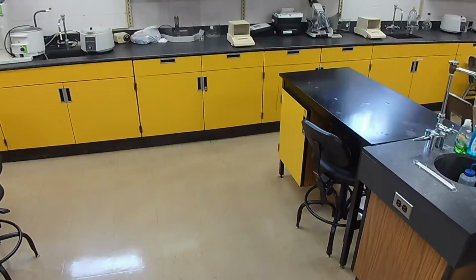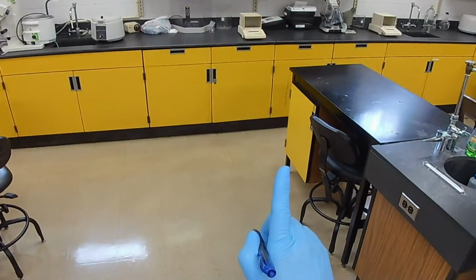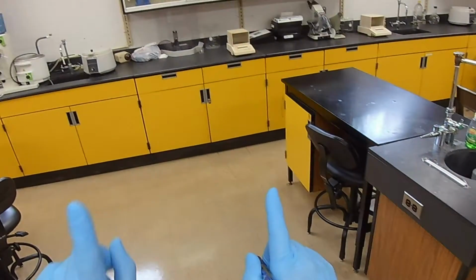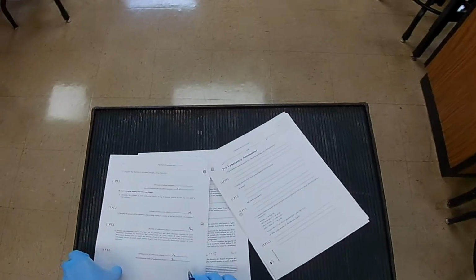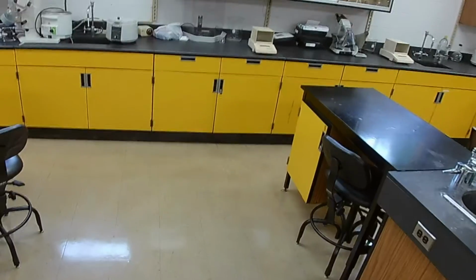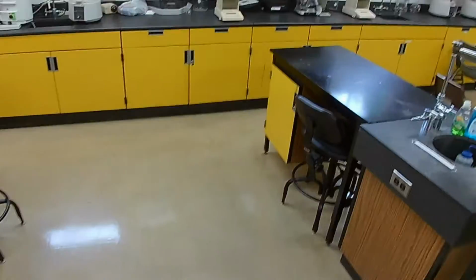The same number has different units because 1 milliliter is equal to 1 cubic centimeter. But in this case, it's going to be grams per milliliter because those are the units that we determined by measurement. So just use those values. Don't bother converting. It's just grams per milliliter for the solid object.